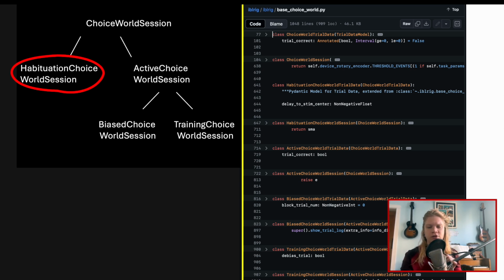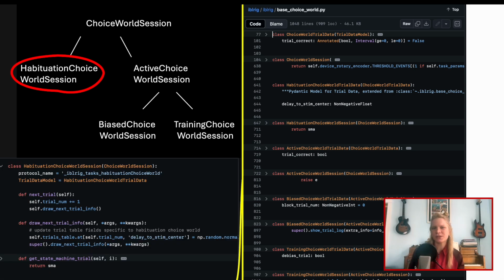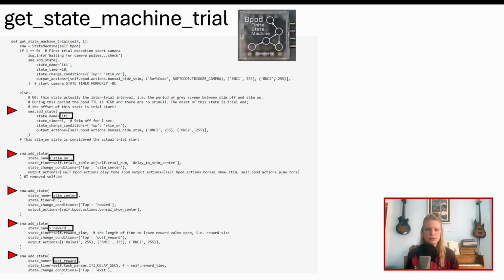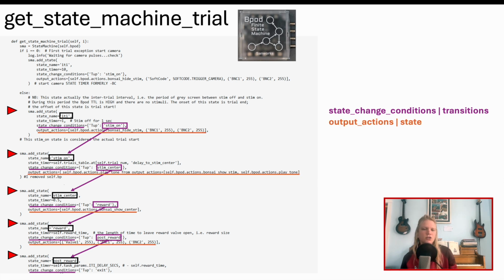habituationChoiceWorld has a whole slew of definitions inherited from ChoiceWorld session, and 3 set to differ from the parent class. First is get state machine trial. I'm switching views here a little since I'm off GitHub now in my personal scripts. The state machine in question here being the Bpod get state machine trial sets the sequence of states making up each trial. habituationChoiceWorld session has its own definition of this function that overwrites the more complex parent classes. Look for the add state command, which assigns two qualities to a state, its state change conditions, which dictate the next state, and output actions, which generate actions. These can be TTL outputs or mixin mediated actions. Hence, these states are strung together, proceeding through an intertrial interval, stimuli presented at two locations, a reward, and a post-reward state.